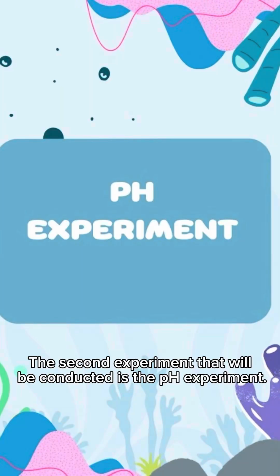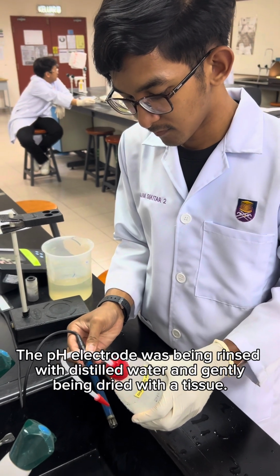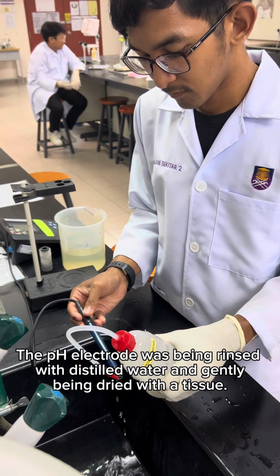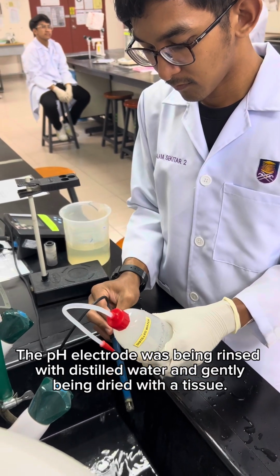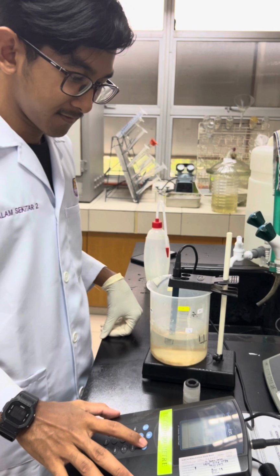The second experiment that will be conducted is the pH experiment. From this particular experiment, the value of pH of the wastewater will be obtained. The pH electrode was rinsed with distilled water and gently dried with a tissue. The electrode is then immersed in the wastewater sample.